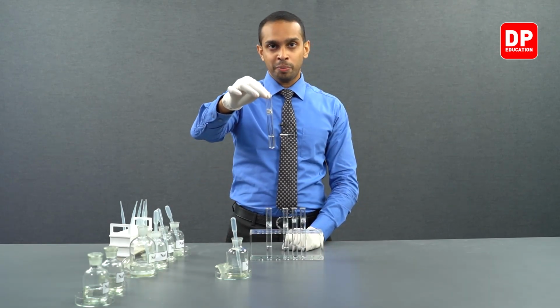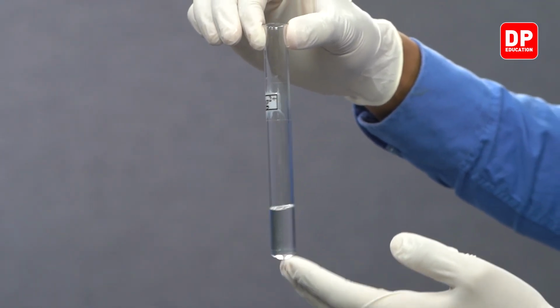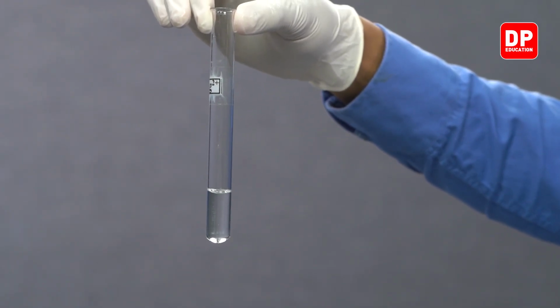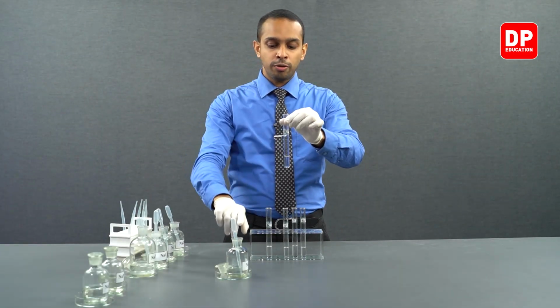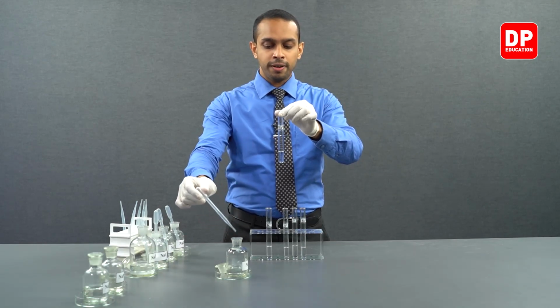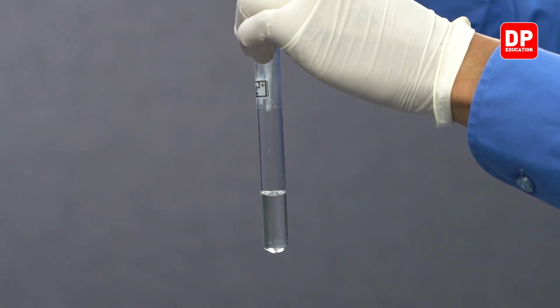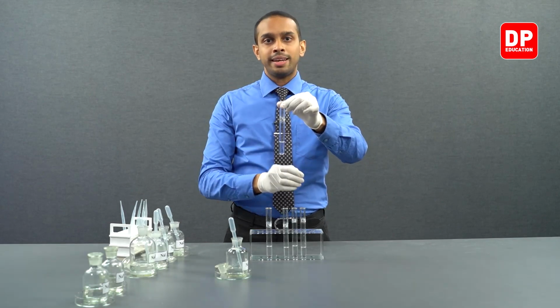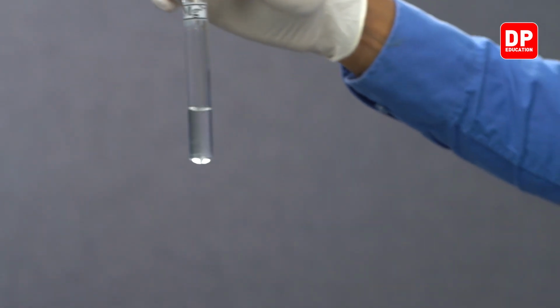Now we can move on to magnesium 2 plus ions. Again, we obtained this magnesium 2 plus aqueous ion solution with the help of magnesium nitrate. So what you see here is magnesium nitrate, and magnesium 2 plus ions are in the medium, so we can introduce sulfide ions by addition of sodium sulfide into this. So let's take a small amount of sodium sulfide. When I add a few drops of sodium sulfide, that introduces a small amount of sulfide ions into this test tube.